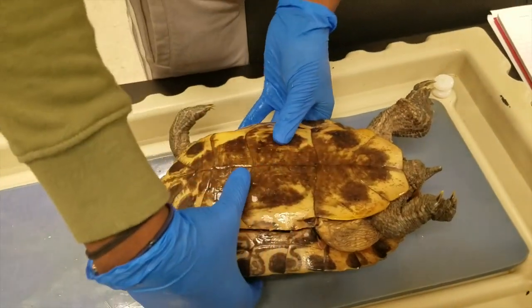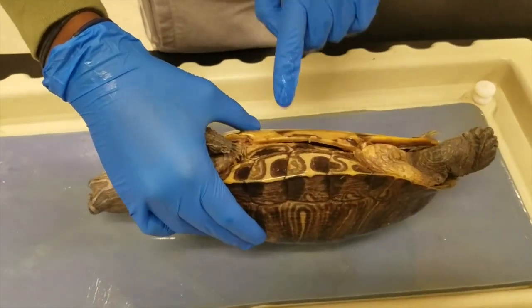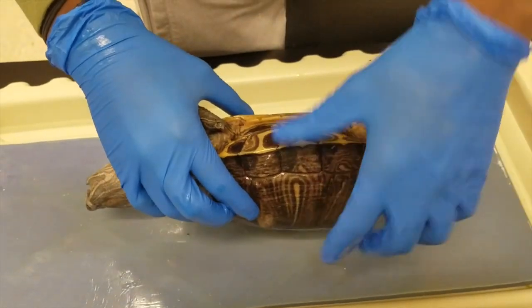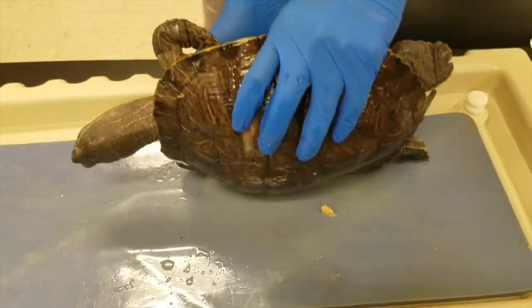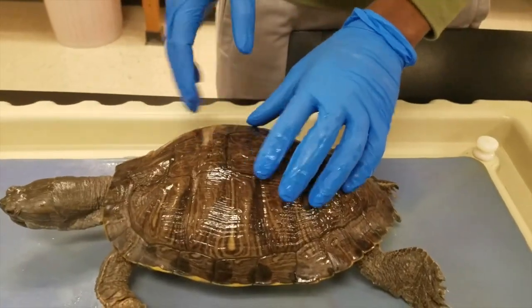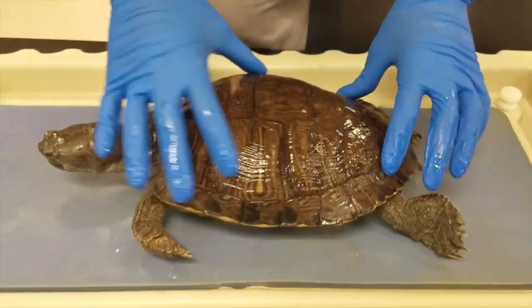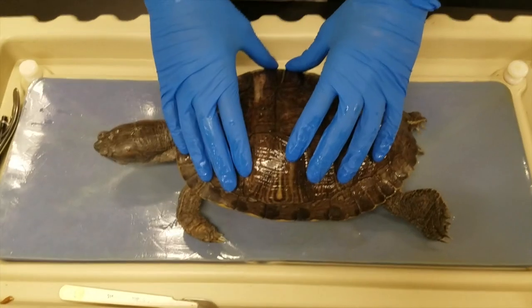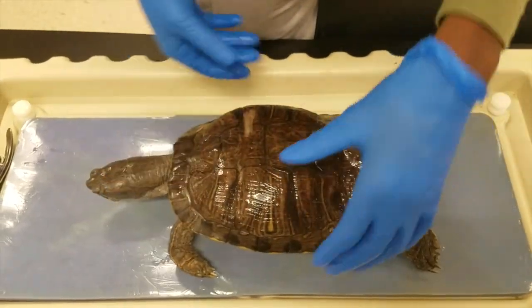We have the bridge right here, which connects the plastron and the carapace. And if we just flip over to the dorsal side of the turtle, we'll notice that the carapace has this sort of pattern, which is useful in distinguishing the turtle from other species.